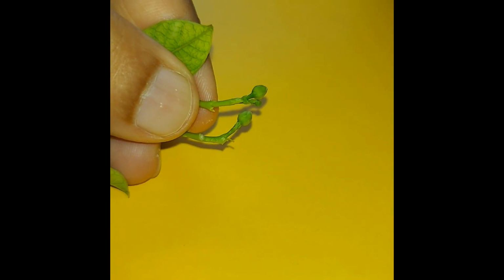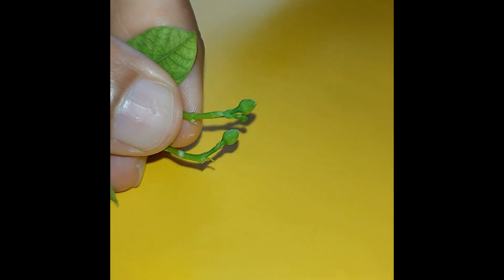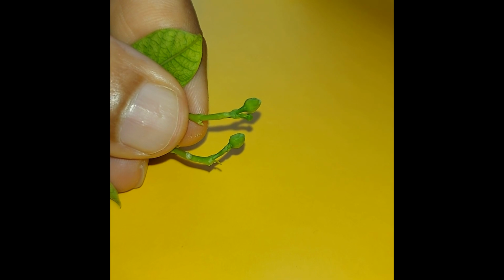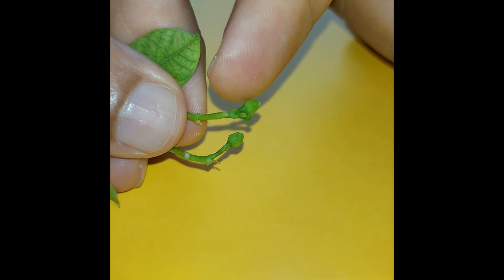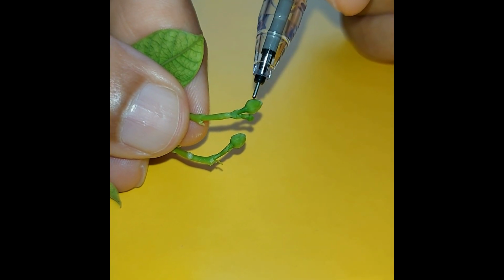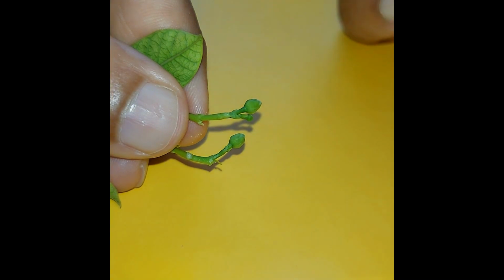Okay, just now I showed you the flower which is already bloomed but not yet fully bloomed, and now these are the flowers which are still in their buds. Okay, inside this bud is this whole green thing which is covering the bud. The whole flower is actually covered by the sepal. The sepal will cover the whole structures, the male and female structure of the plant, and it will slowly shrink and sometimes wither and fall off.